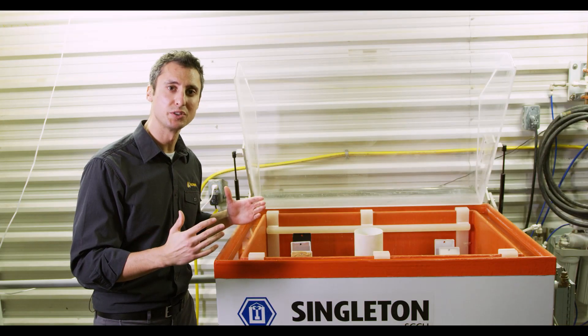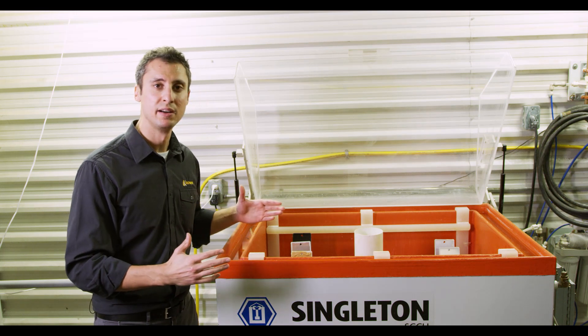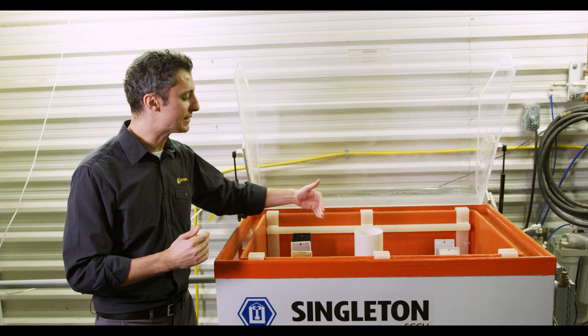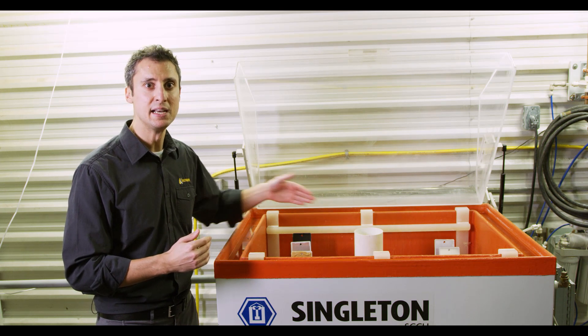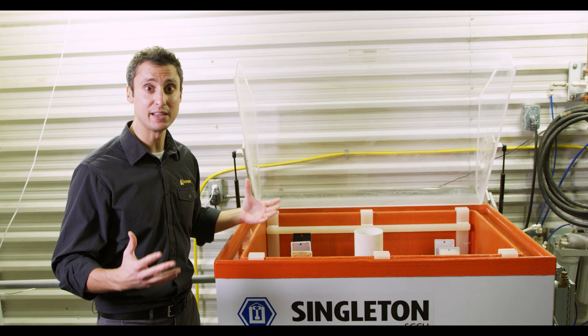Here our samples are loaded into the salt spray chamber. We've spaced them in such a way that they're an even distance from the actual salt spray cylinder in the center of the machine. Now we're going to fire this machine up and get this test started.